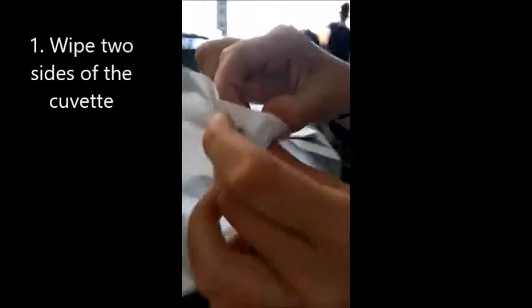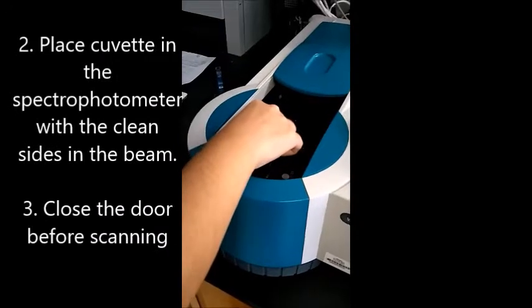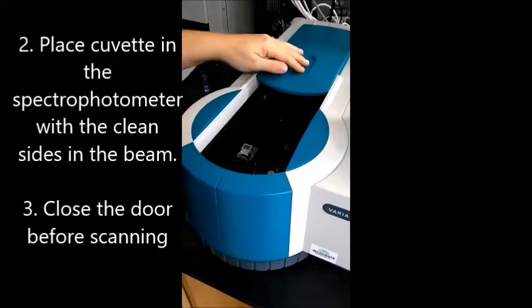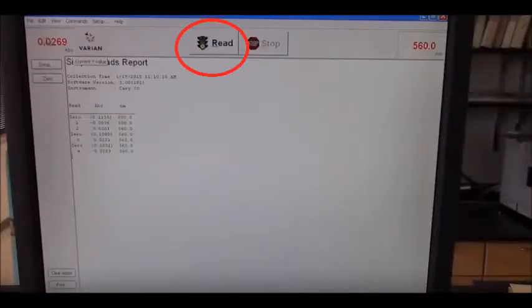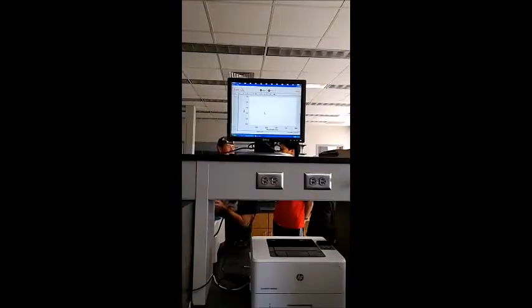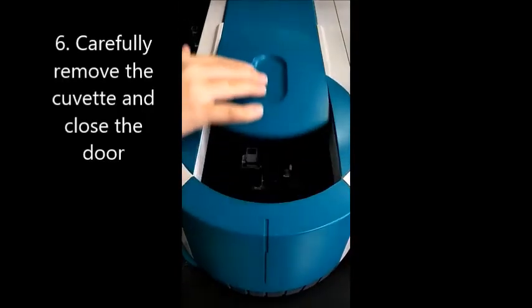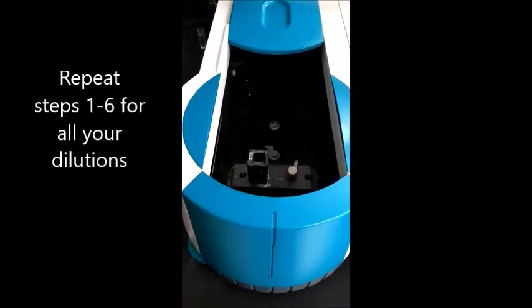First, wipe two sides of the cuvette. Next, place the cuvette in the spectrophotometer with the clean sides in the beam and close the door before scanning. Next, click Read at the top of the screen to begin scanning. Record the absorbance value shown in the top left corner in your notebook. Carefully remove the cuvette and close the door. Complete steps 1 through 6 for all your dilutions.